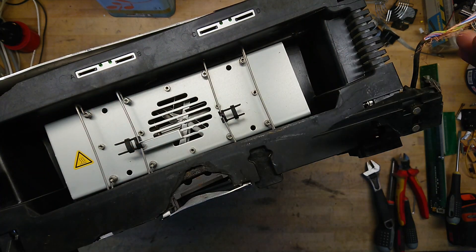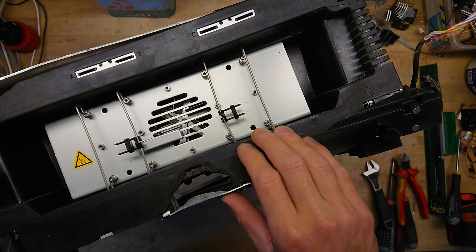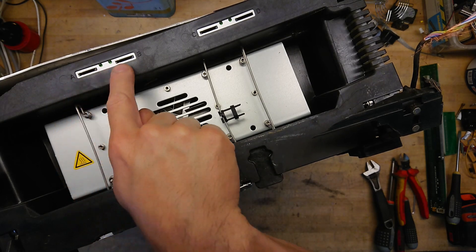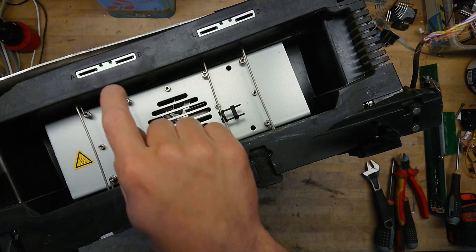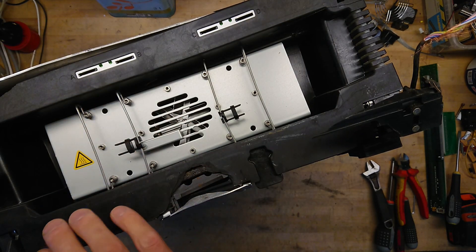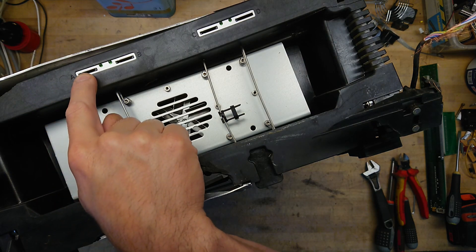The whole front here is missing. It had a nice big blue display, as you can see in this product picture I found of this unit. It also has A, B, C, D input ports for ID cards that you insert, so the machine knows what kind of sample you are running. This is simply a tracking ID for your experiments.